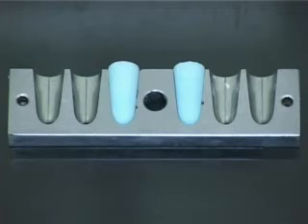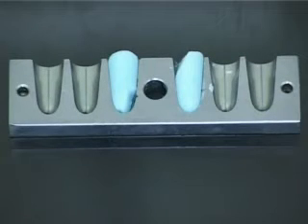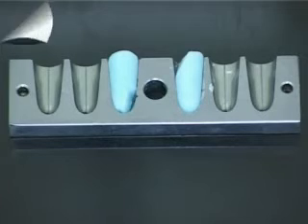Ideally, the suppositories should be uniform in shape and colour and have a smooth profile. These suppositories have been damaged either on removal from the mould or in manufacture — they may have been poured when the base was too close to the solidification point.